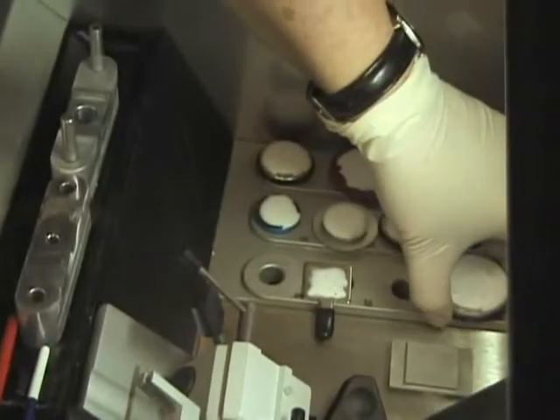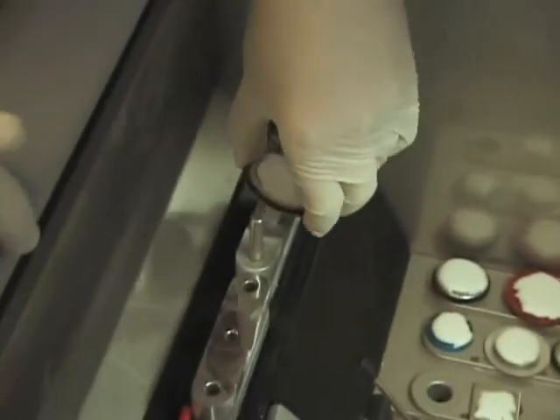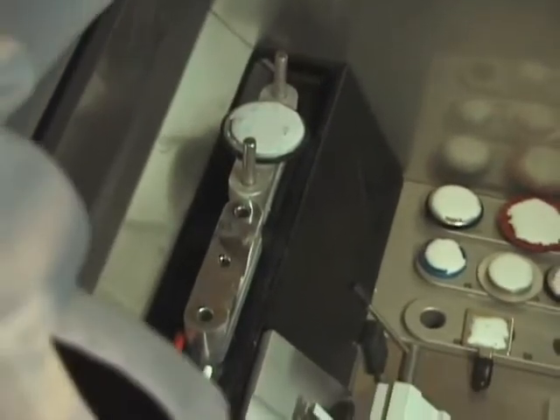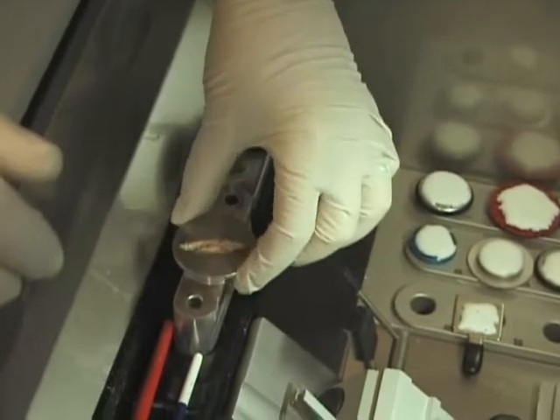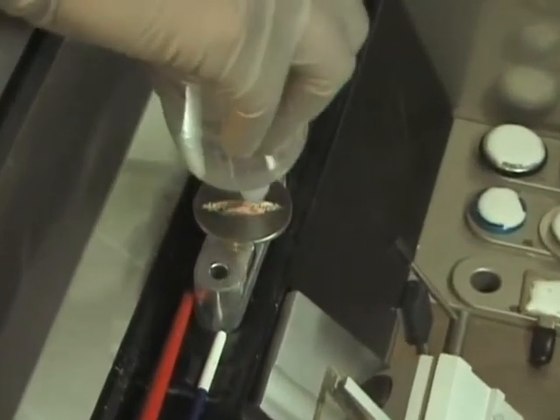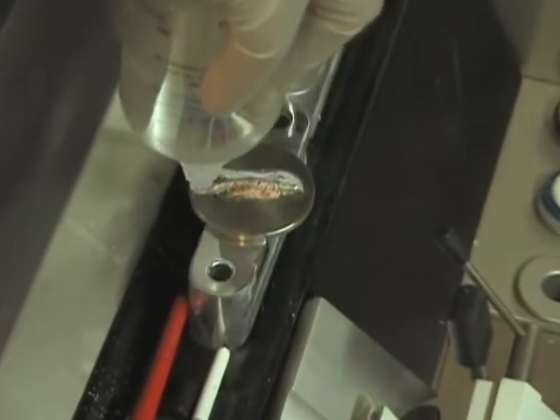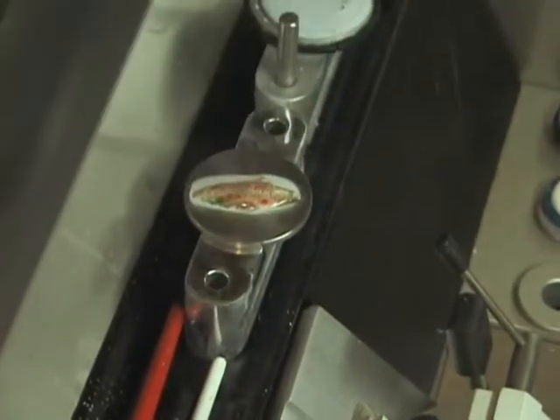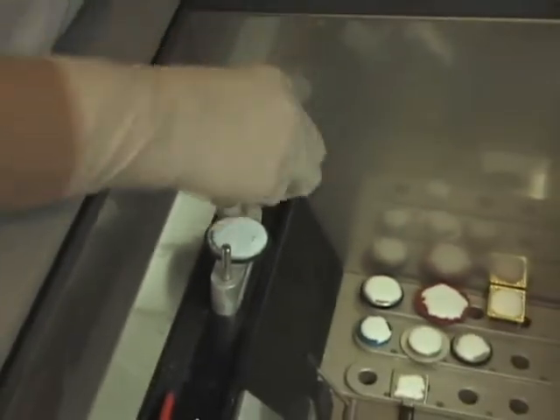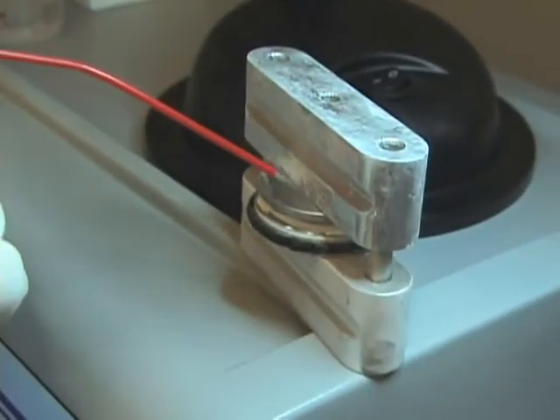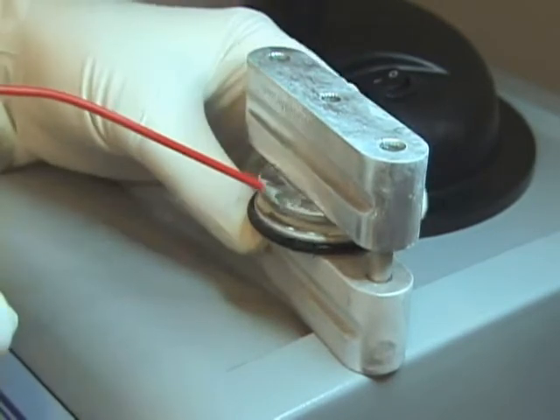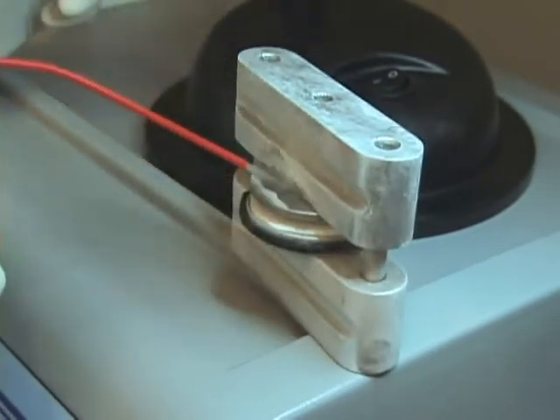There is a large flat disc included in the cryo-embedder system for larger specimens. It will accommodate tissue that is the length of a microscope slide. The embedding process for the larger specimens works the same as with the smaller discs that are the width of a microscope slide. The transfer of temperature through the metal disc into the tissue will not cause crystal artifact, as sometimes happens with tissue that is dipped into liquid nitrogen or sprayed directly with freeze spray.